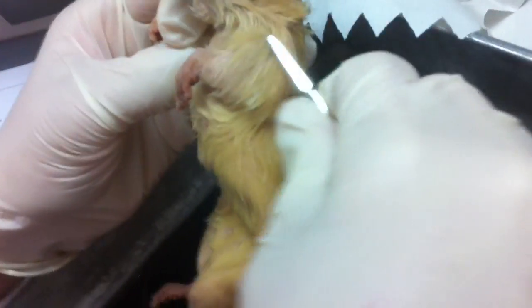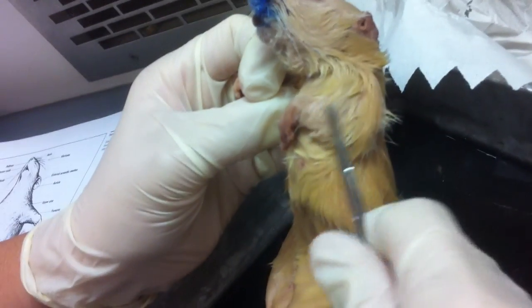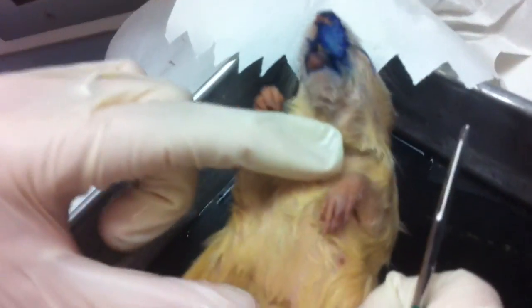Here is your upper arm and your forearm. So upper arm and forearm, both sides. And then this is your thorax and then your abdomen.